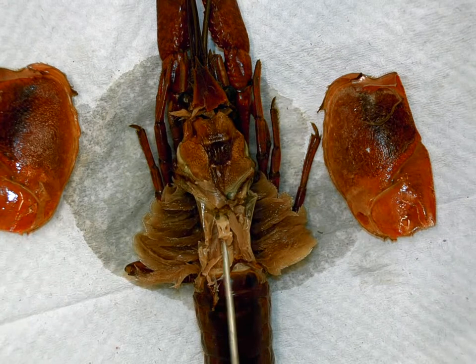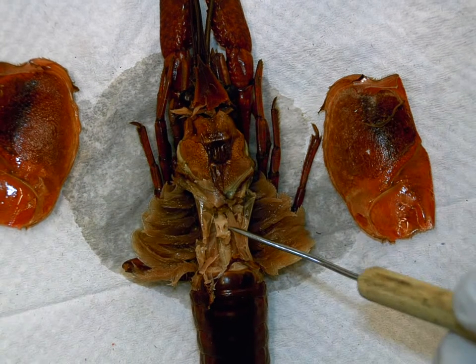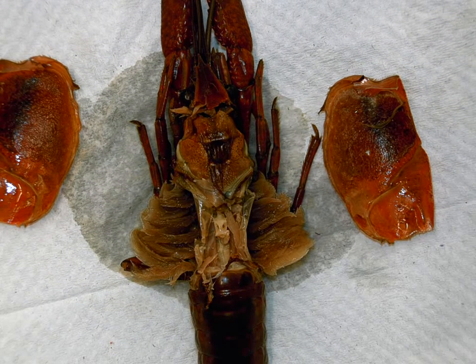...this kind of white, creamy-ish structure, which has two obvious holes in it — here and here — which are the holes in the heart, known as ostia.